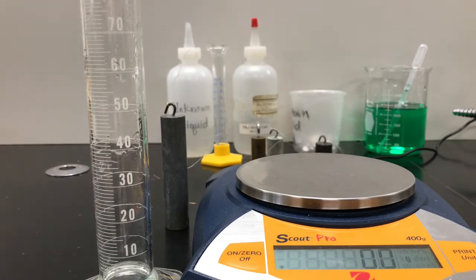We're going to find volume by displacement. So we're going to use the change in water level to find the volume of whatever we submerge into the water. The cylinder's volume we could find by calculating using the geometry formula for the volume of cylinders, but for our purposes, let's work with displacement.